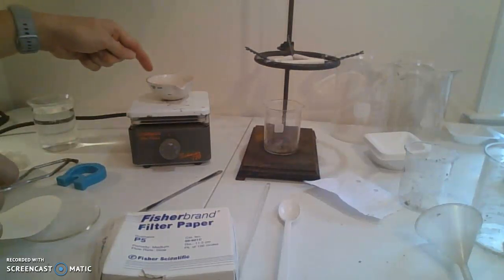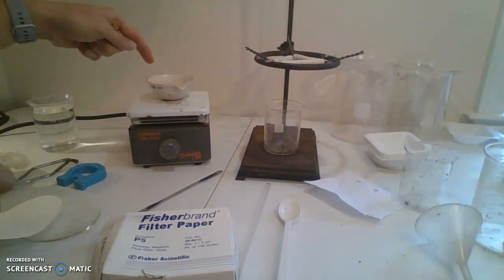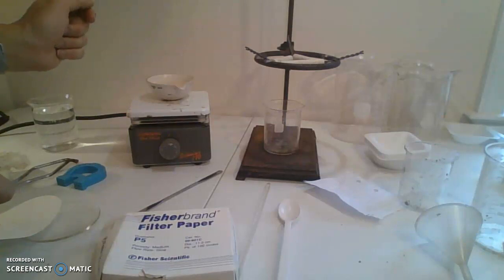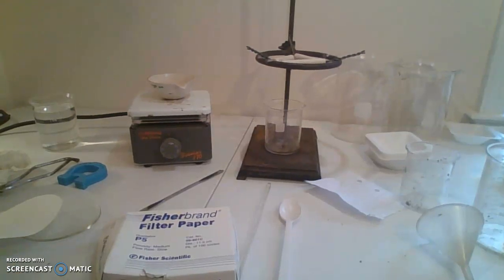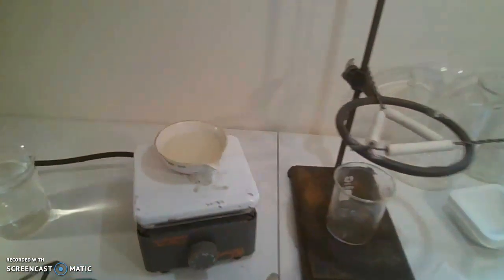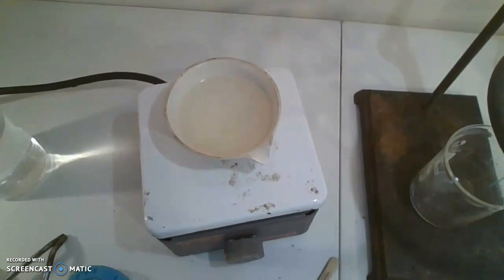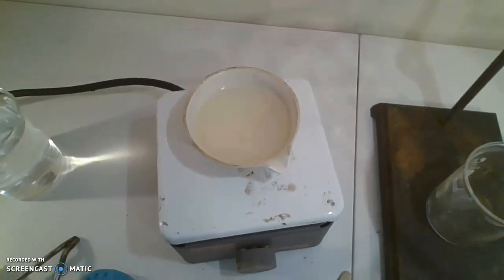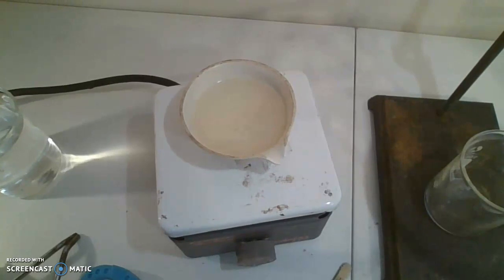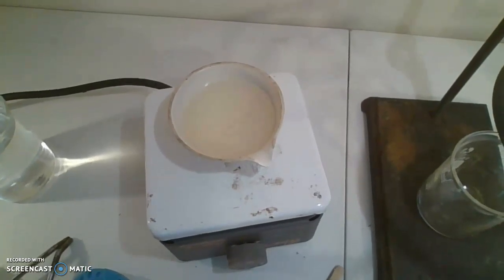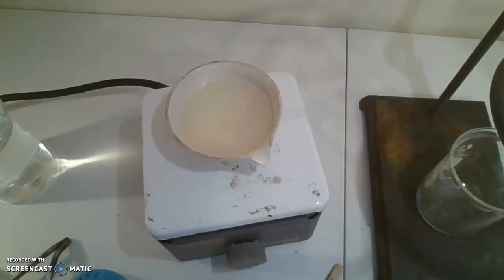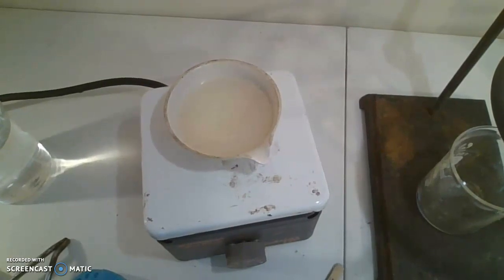In this video I'm going to show you what happens in the evaporating dish on the hot plate. The salt water is inside and getting quite hot. It is boiling and bubbling and steam is coming off, which will leave some salt residue behind.